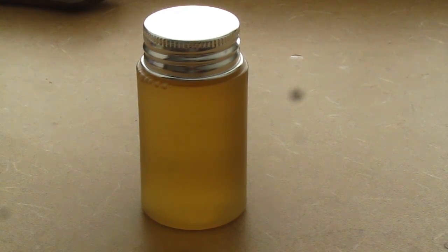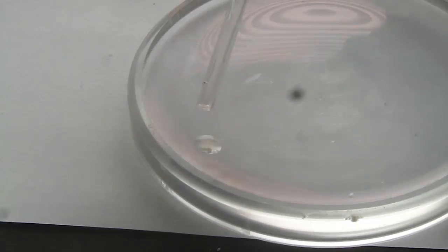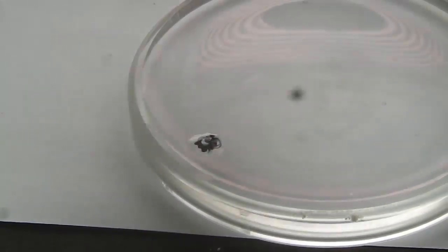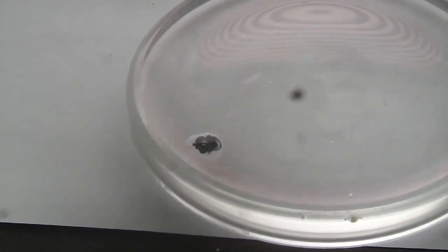Today we're making the Marquis Reagent, which is a mixture of two different chemicals used to determine what a chemical is based on the color it turns and the reaction time and the length it takes for a color to turn different shades of a certain chemical.